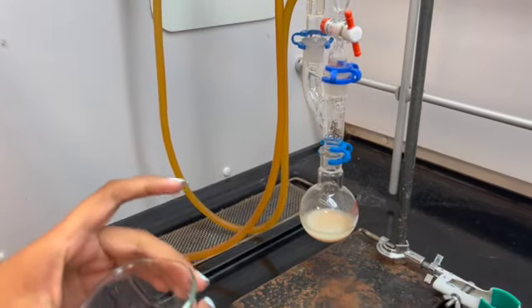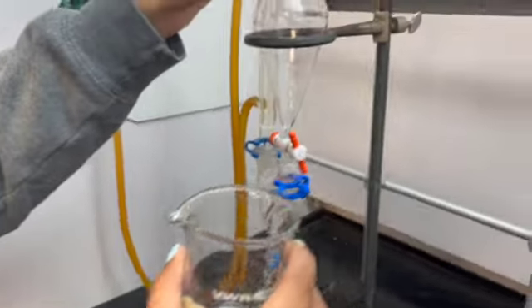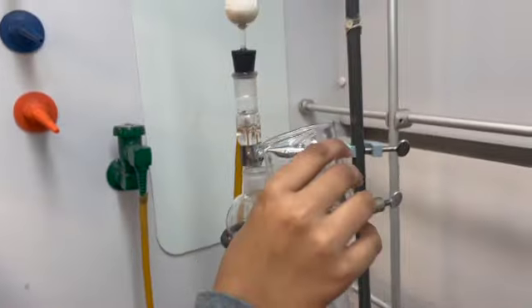Now we will continue by adding HCl into the funnel as well, which will then be dripped in.